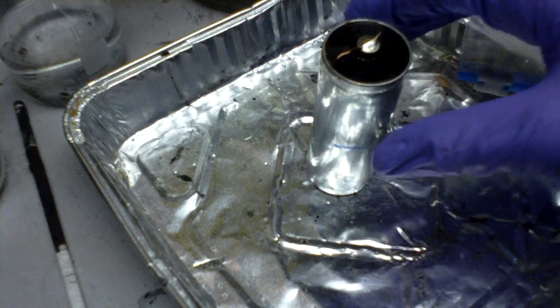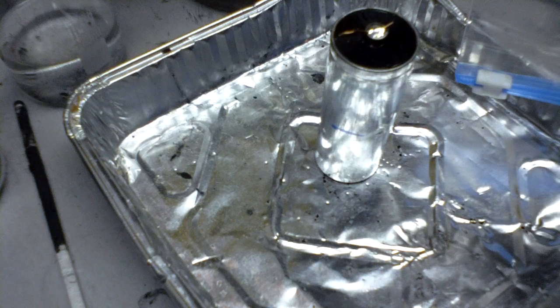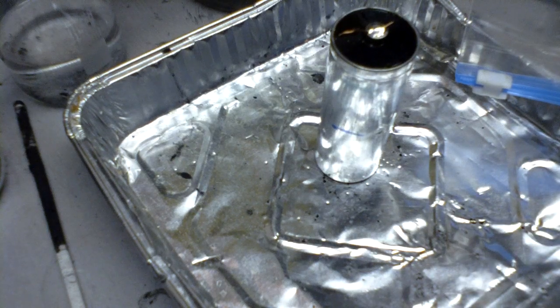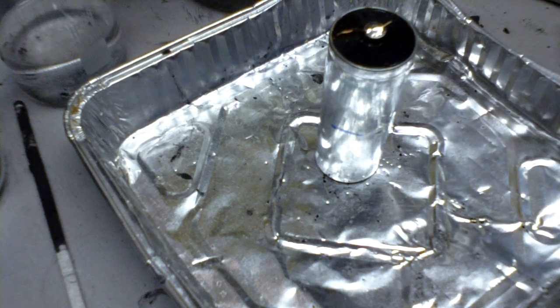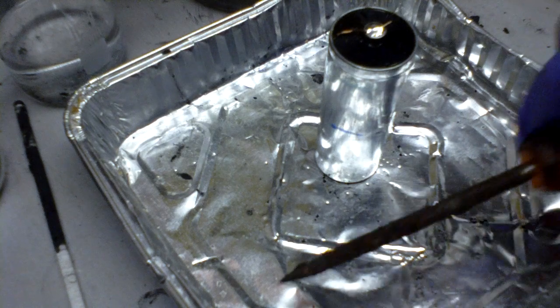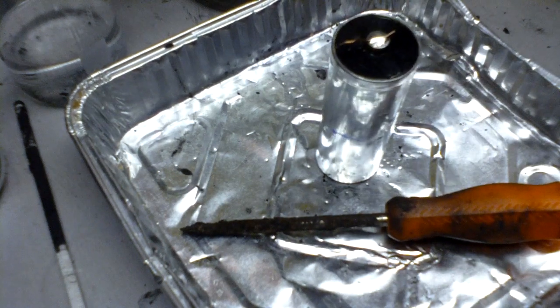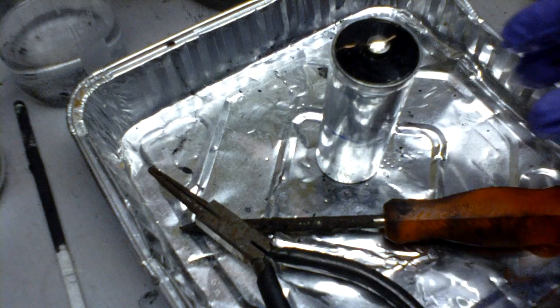First, a word of warning. Inside these batteries have manganese dioxide, which is a black compound that stains everything including your skin and your tools. I have some old tools that I use for taking apart batteries because I don't care about them.